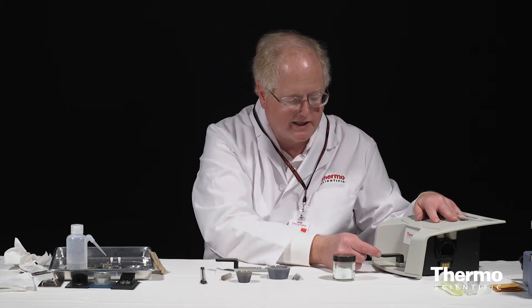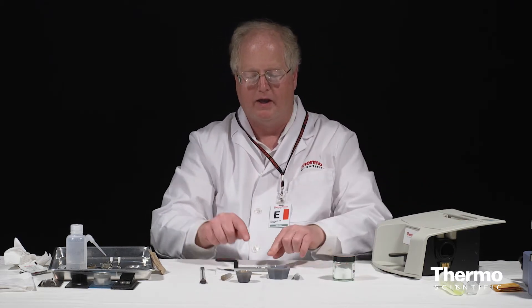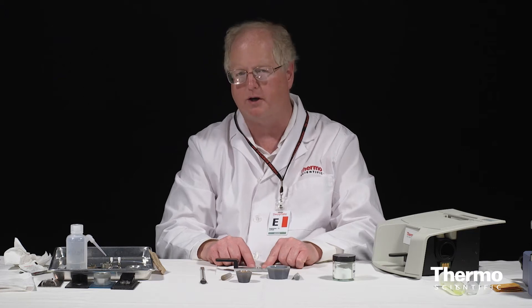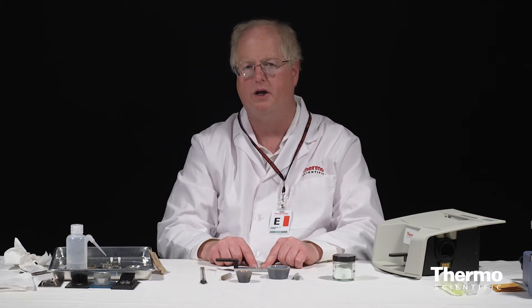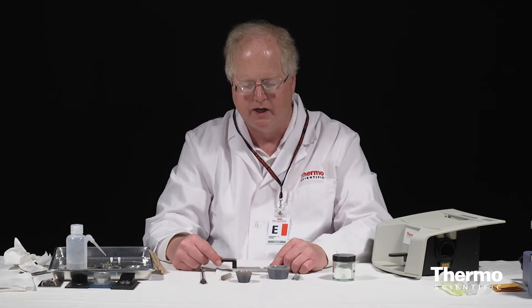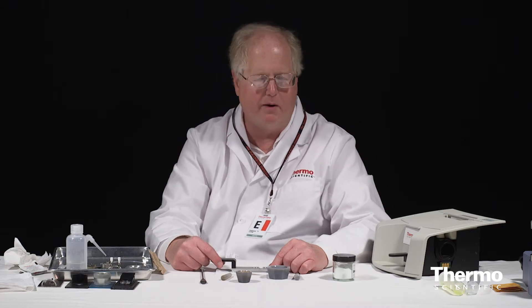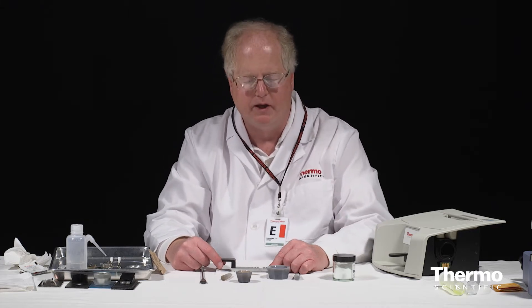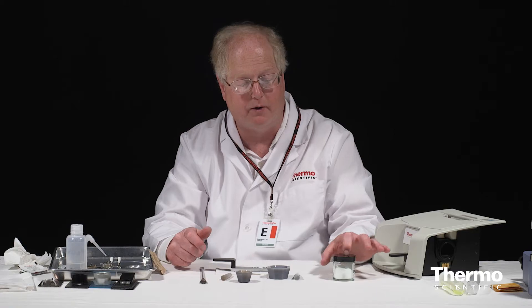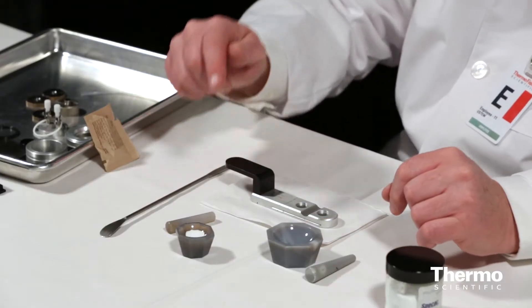I'm mainly going to be working with this one though, because I want to fill the cups for use over at the spectrometer. So what I want to do is prepare my sample by grinding it up using potassium bromide powder and a mortar and pestle.